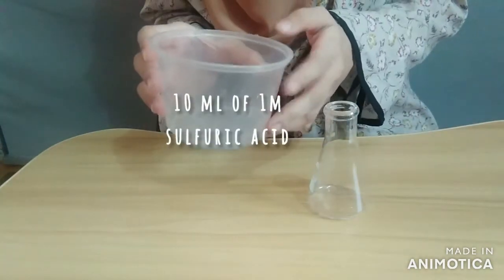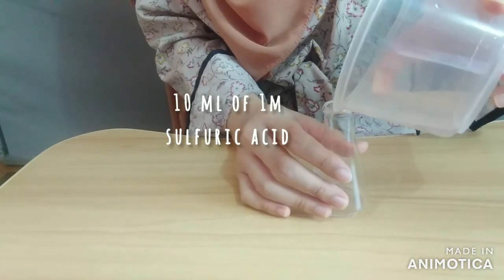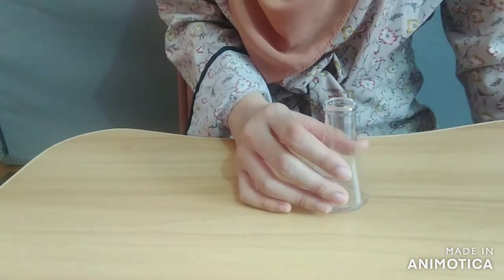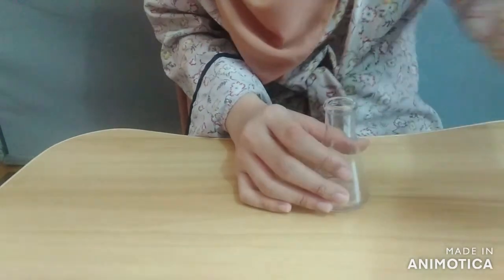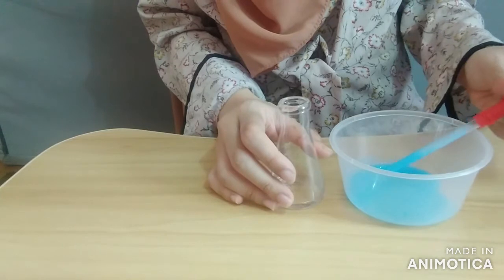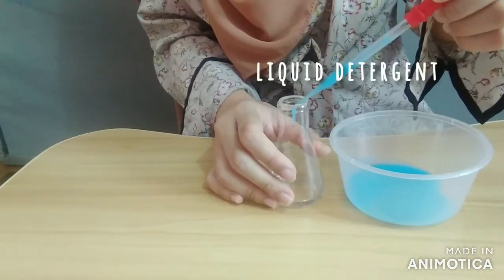Now add 10 ml of 1 molar sulfuric acid, and then add a drop of liquid detergent into the conical flask.